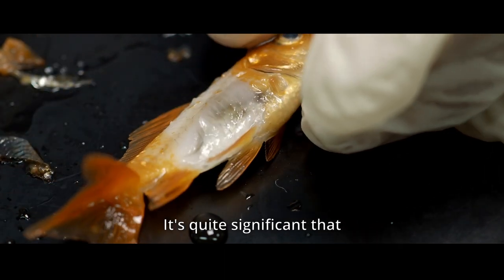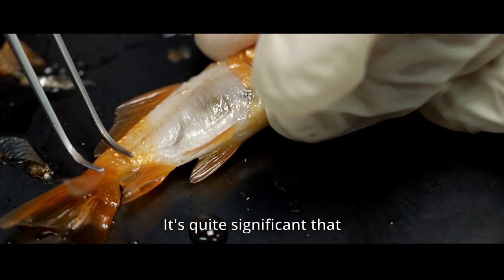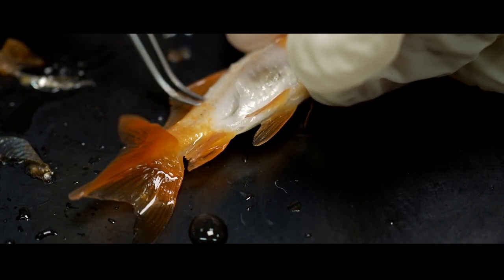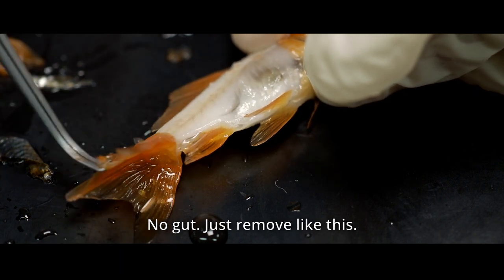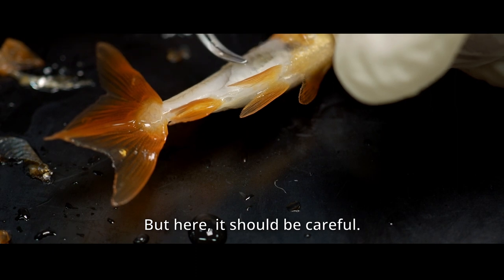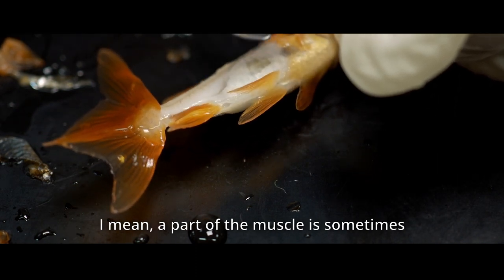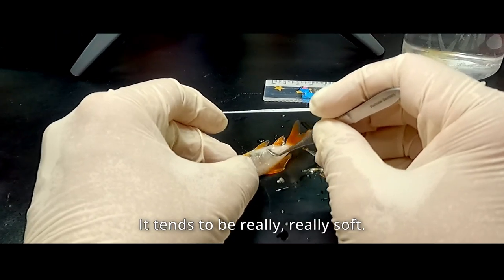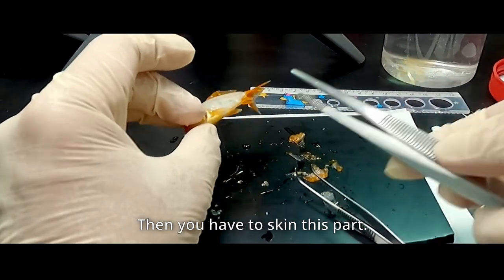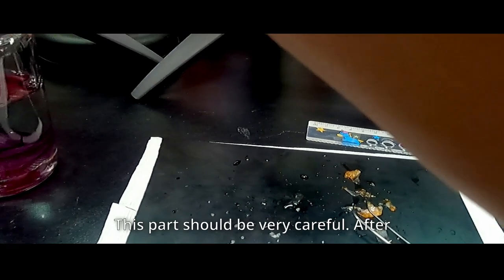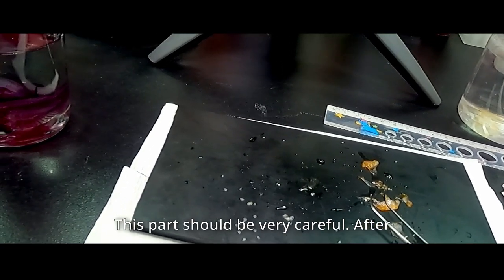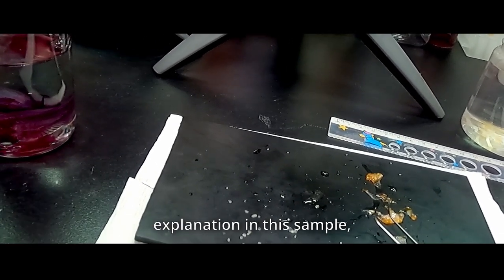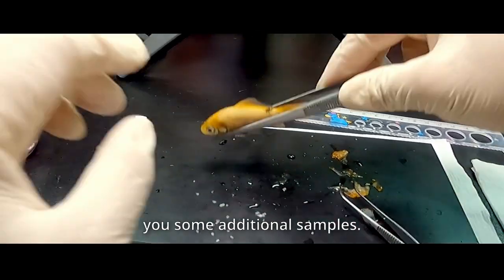And where is quite scary, quite significant to the part to be careful. This place is okay. I mean, there is no gut. No gut. And just you remove like this is okay. But here, should be careful. I mean, the part of the muscle is sometimes digested by the enzyme from the intestine. And then, to be really soft. Then, I have to skin this part, should be careful. After, and additional, giving additional explanation in this sample, I will, the next I will give you some additional sample.